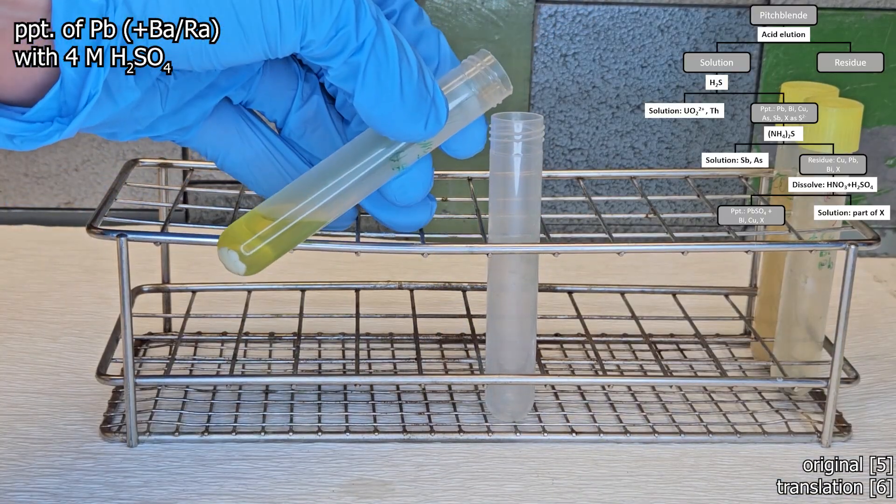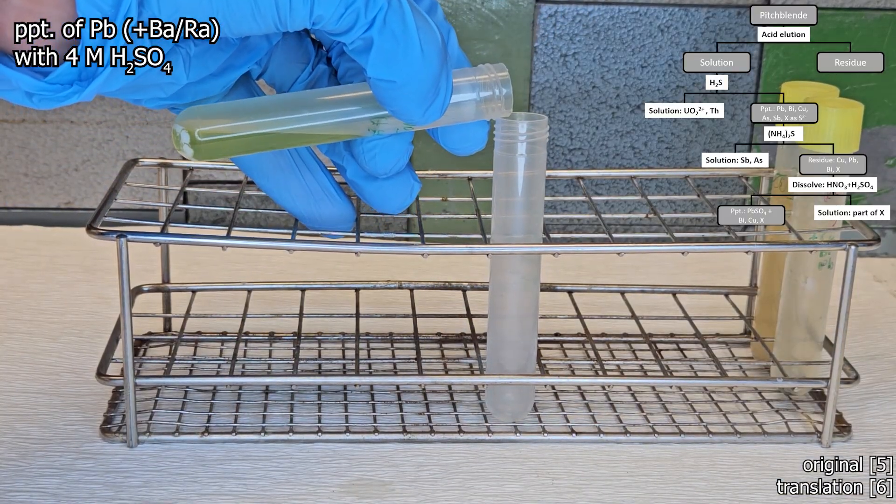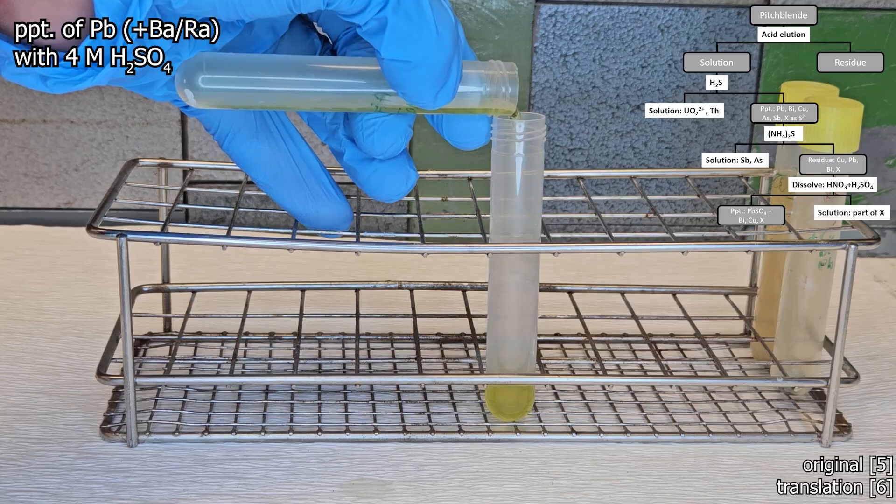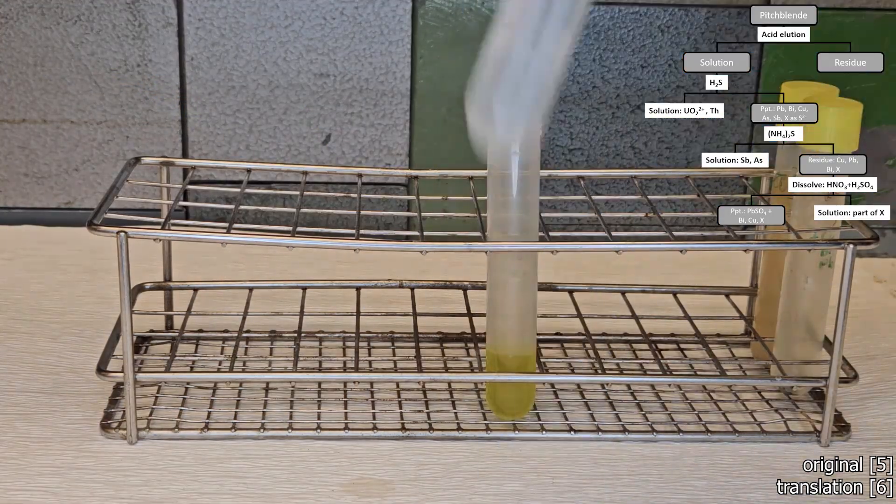Here I also added 10 milligrams of barium carrier as preliminary tests showed that otherwise the amount of radium contained will cause problems later in the spectrum.